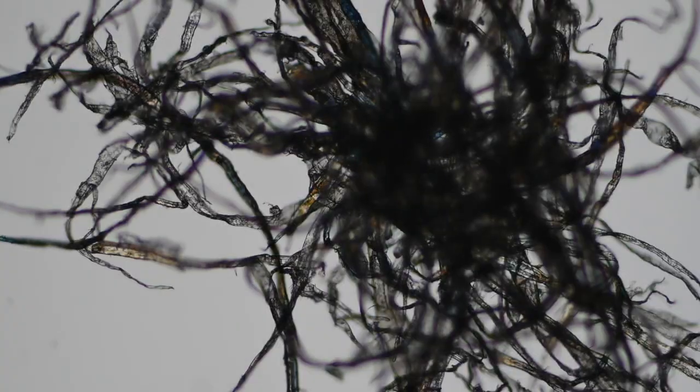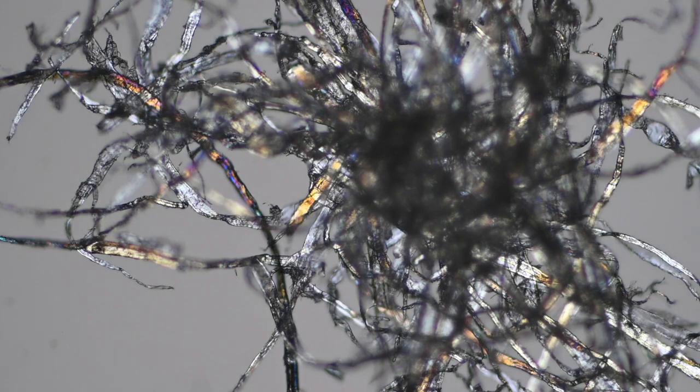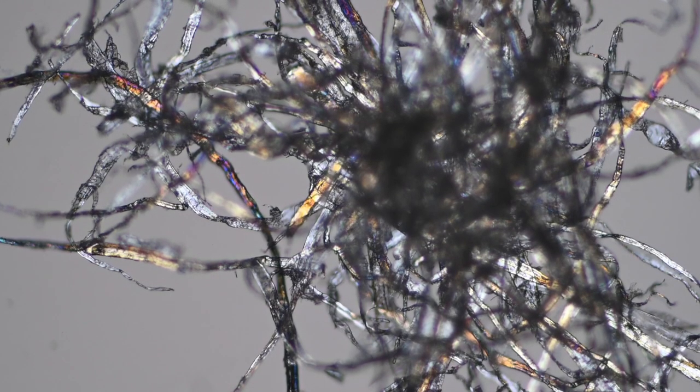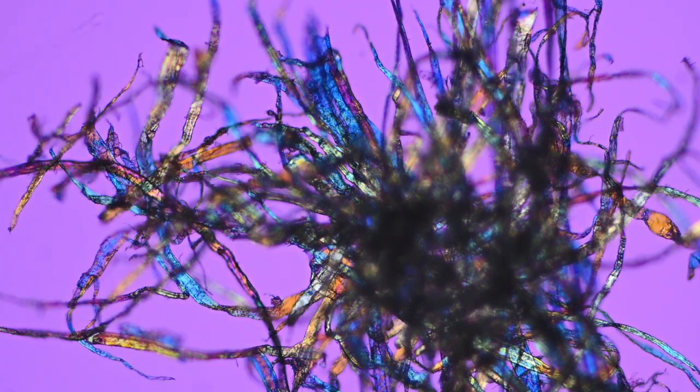So depending on what you put under the microscope, you get totally unexpected results, which is always really fun to see. So here's, for example, a particular area where you can see the strains on the pulling on the fibers has the effect of moving the polarization differently between samples. We can also bring a lambda plate into the picture. And a lambda plate allows you to change the background color too as it shifts. There's a lambda delay in there with respect to the polarization plate. So you can get some really incredibly beautiful effects.